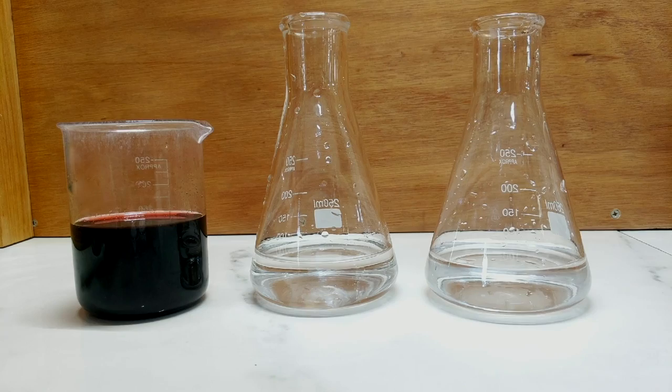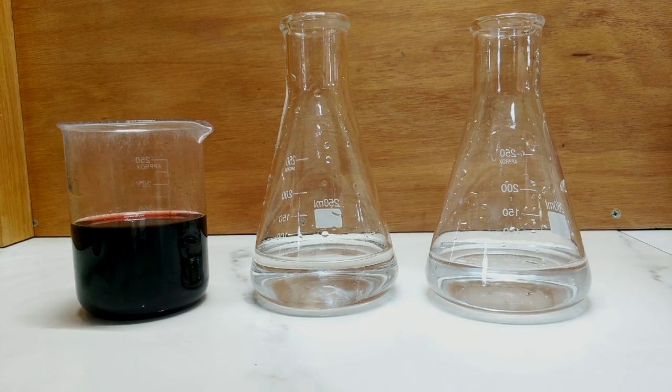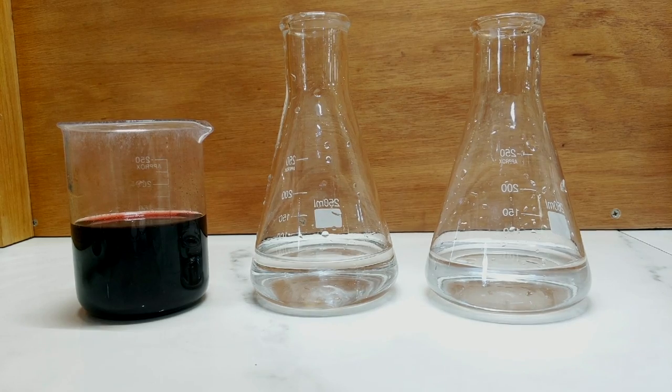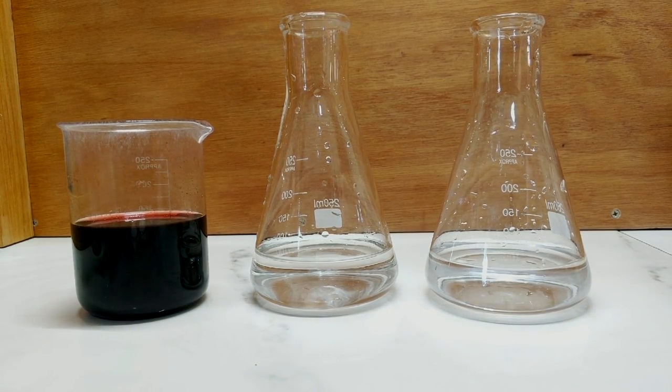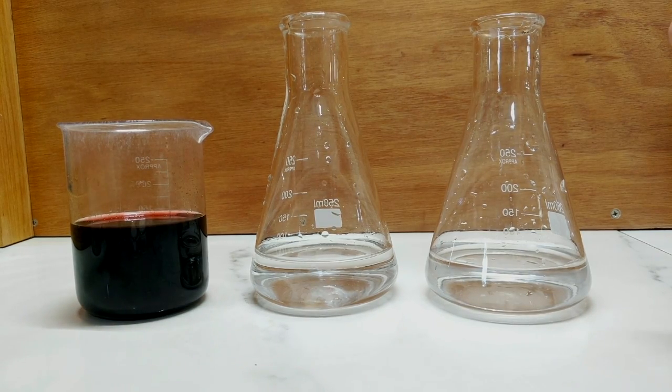Hello and welcome back to the Alchemical Arts. Today is going to be a short video of just running a little experiment on making another cobalt pigment, because we haven't got enough cobalt pigments in our life.